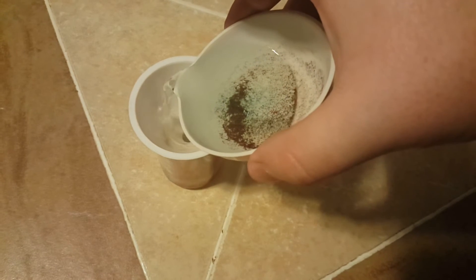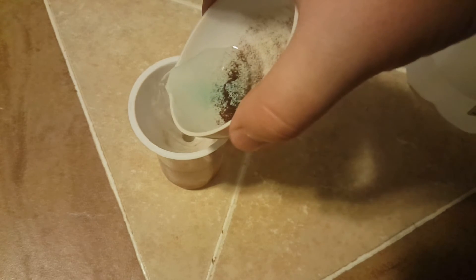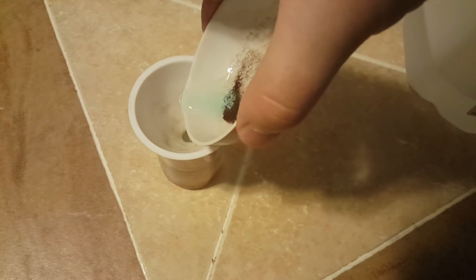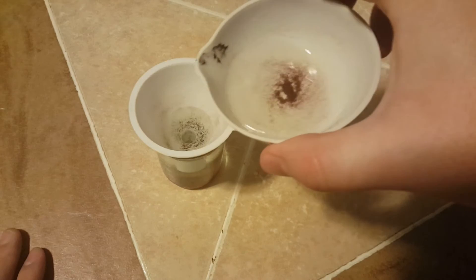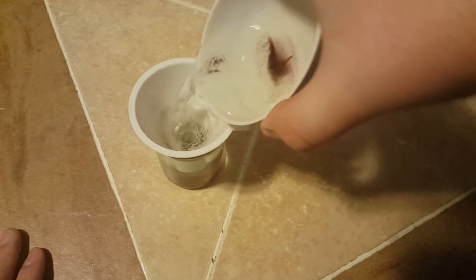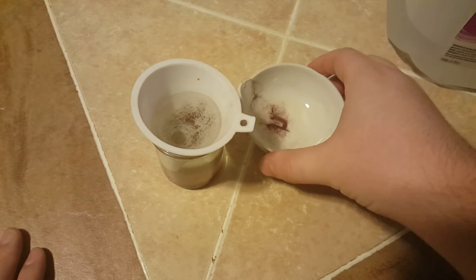It took about two or three washings to get all of the unreacted reagents out of the recrystallization dish, until I realized that I was dumping small amounts of Chevreul's salt into the beaker — so I just decided to dump the entire thing in and decant off the aqueous layer. After this batch of Chevreul's salt was dried I decided to put it in this little vial and show it off.